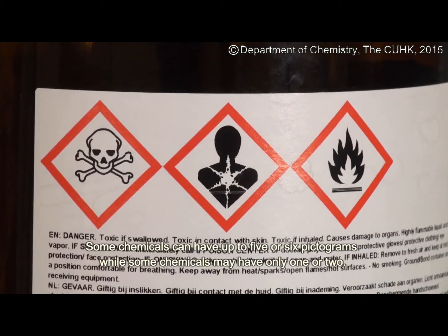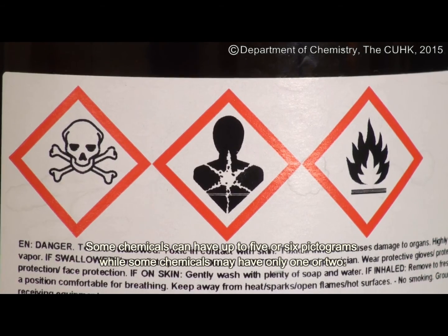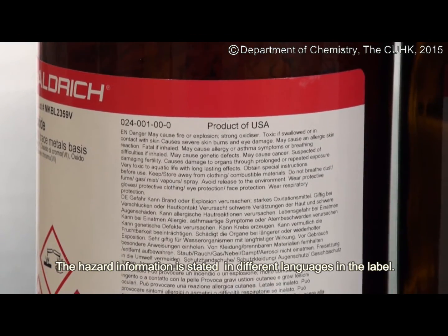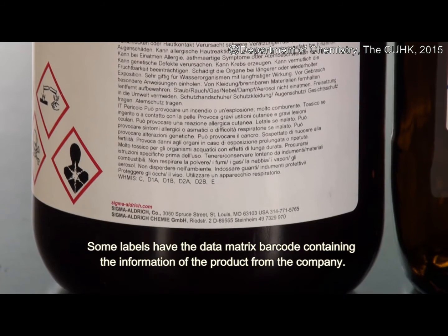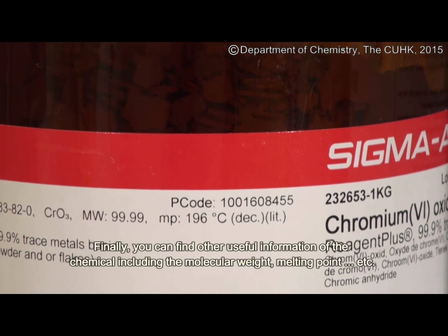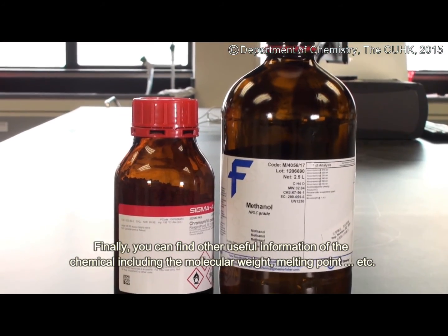Some chemicals can have up to five or six pictograms while some chemicals may have only one or two. The hazard information is stated in different languages on the label. Some labels have a data matrix barcode containing the information of the product from the company. Finally, you can find other useful information of the chemical including the molecular weight, melting point, and more.